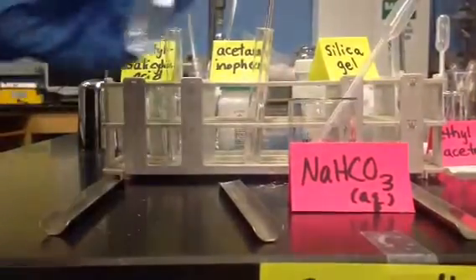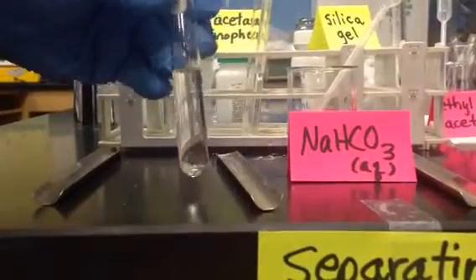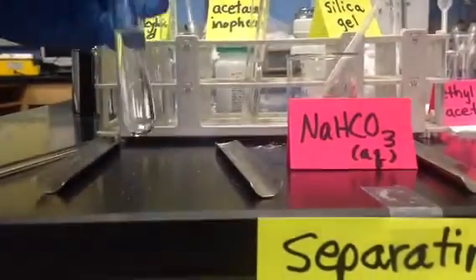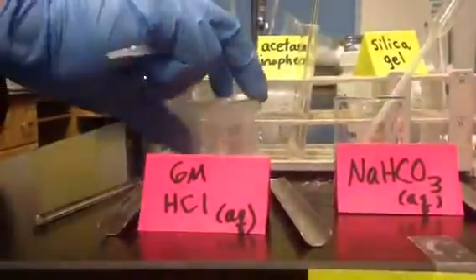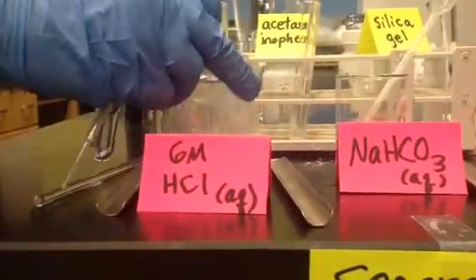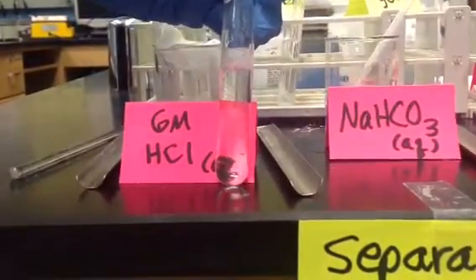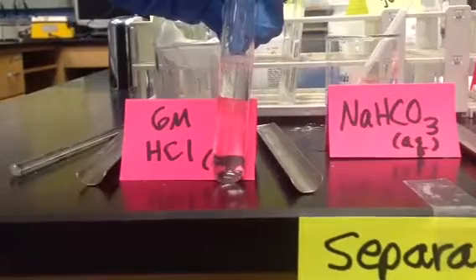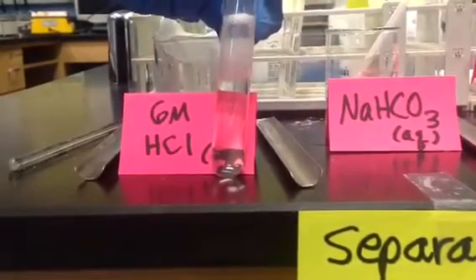So yeah, it was soluble. There's nothing left in that, and that's what we had in that test tube with acetylsalicylic acid. So sodium bicarbonate dissolved it. I want to see if I can recrystallize it by adding 6 molar hydrochloric acid. So at this point, we're going to add this dropwise. That's just the base neutralizing the acid. That's not anything happening with the acetylsalicylic acid.